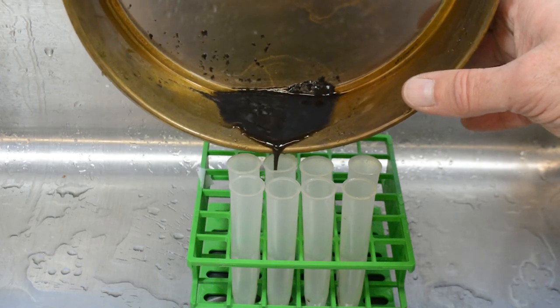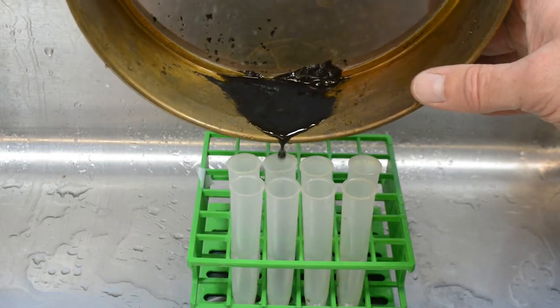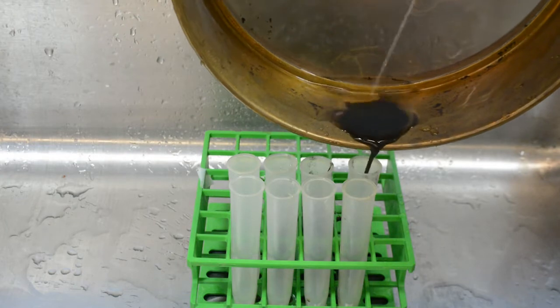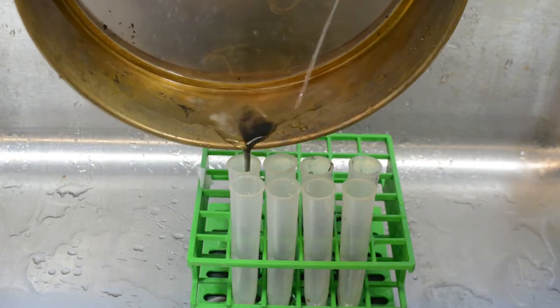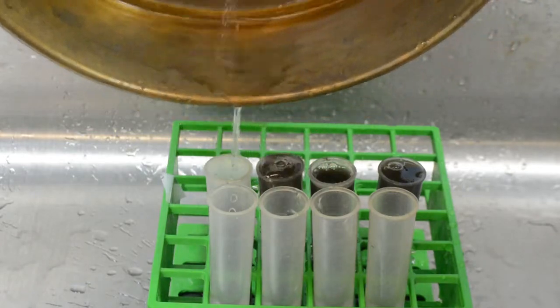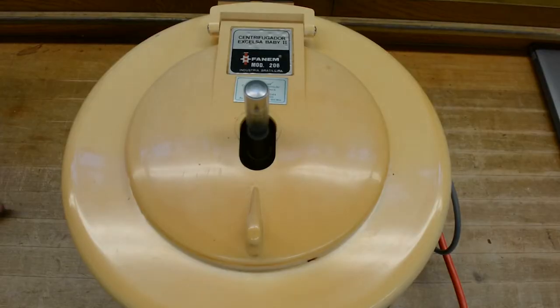Here I have a rack of centrifuge tubes that I am going to transfer my sieve contents to. Water is added by using the wash bottle — the water causes the soil to flow, and we direct this into the tubes. The whole concept is to collect as much of this material as possible. Try to place about equal amounts in each tube, then add water to fill the tubes to help balance the centrifuge. The tubes are then placed into the centrifuge and we spin this for a few minutes, which will cause all of the material to move into the bottom of the tube.